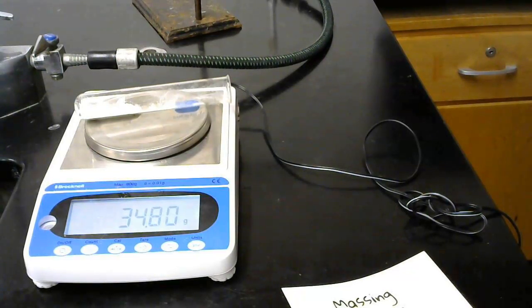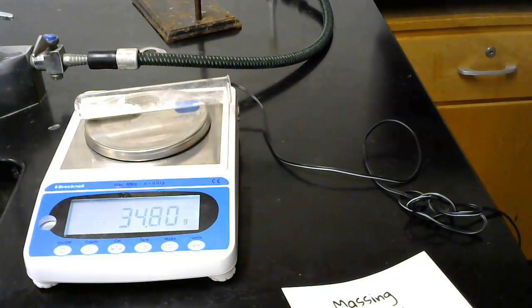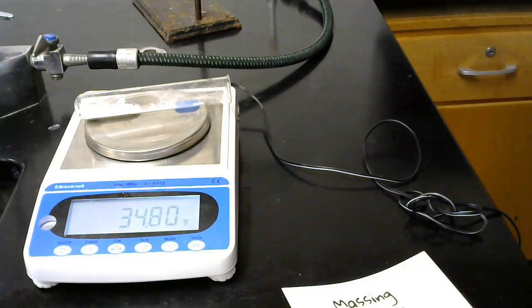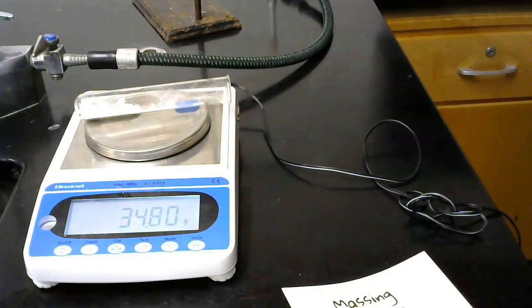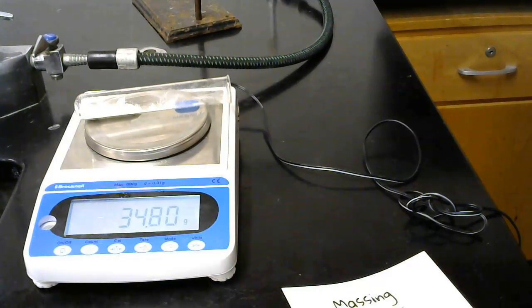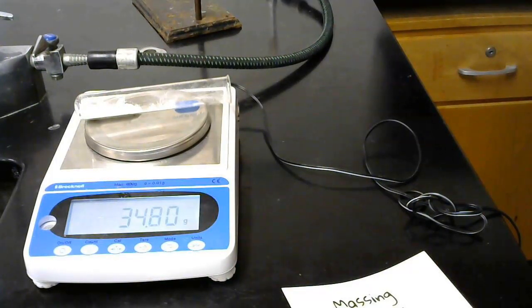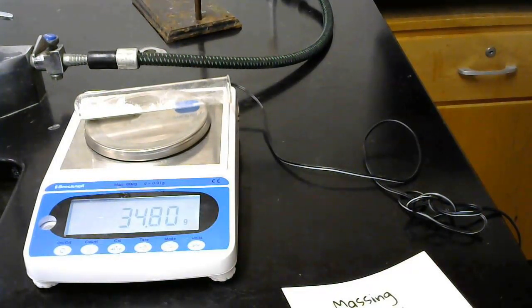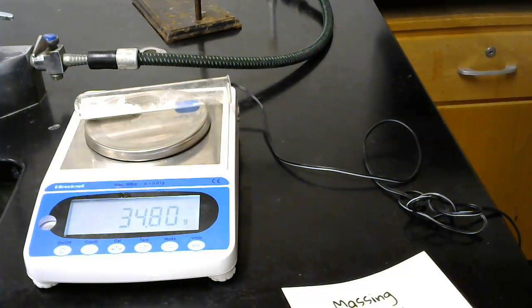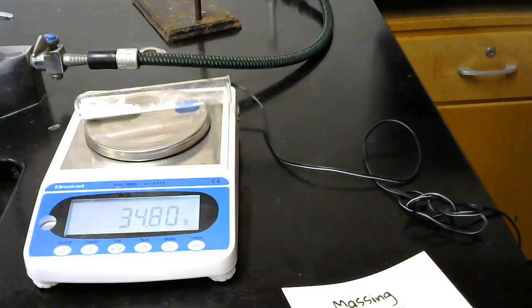That should conclude our lab with all the data that you need. You should be able to go ahead and calculate what I'm asking you to calculate on the sheet. For a grade on this, all your calculations have to prove which equation matches the data. You have two days to do this lab.